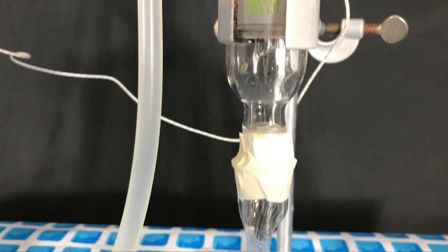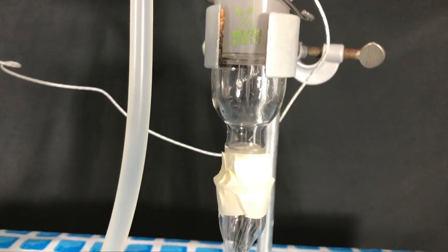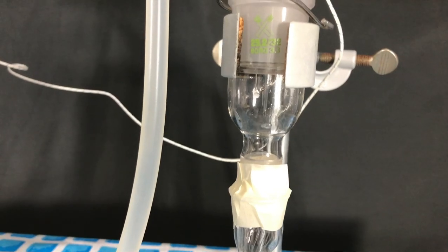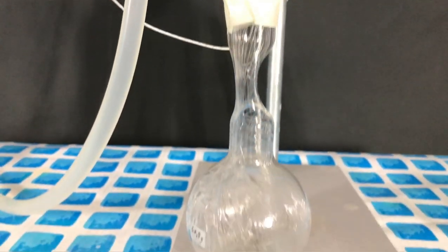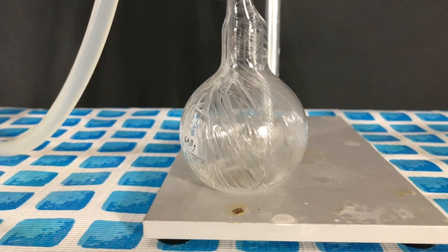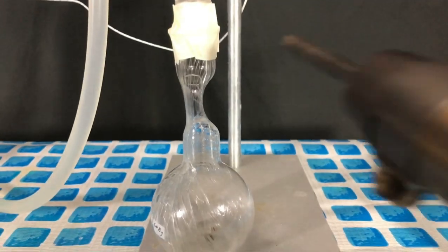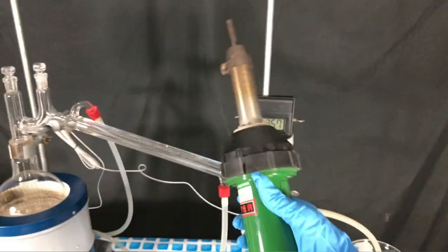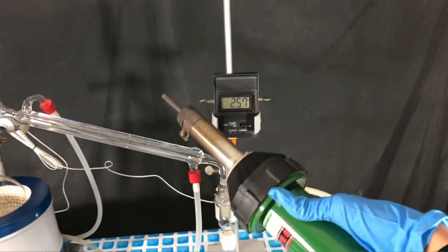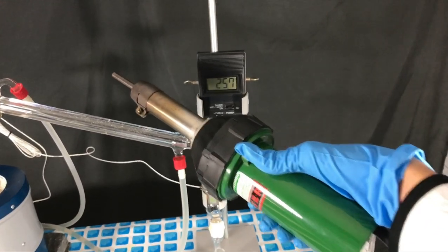Because of the temperature of around 26 degrees Celsius of our cooling water we collected liquid sulfur trioxide at first which solidified once in the flask. If the sulfur trioxide solidifies in the wrong places like the neck of this ampoule, a heat gun can be used to gently melt the sulfur trioxide.